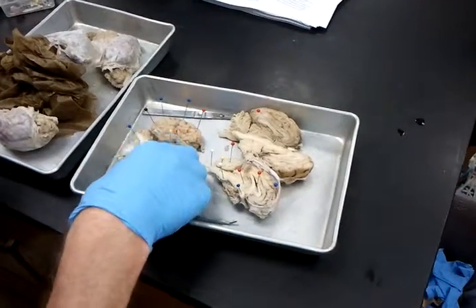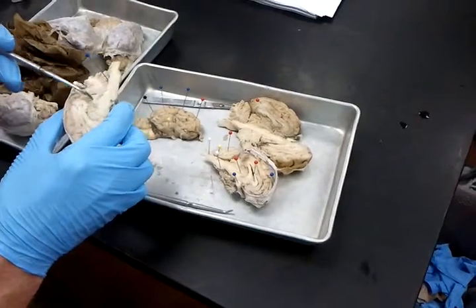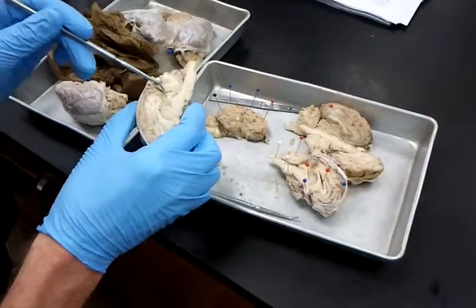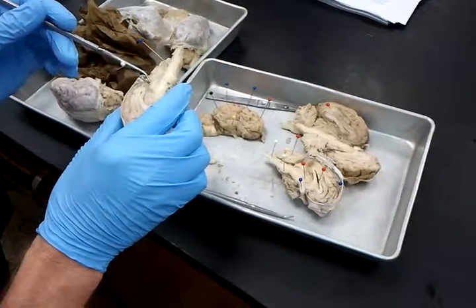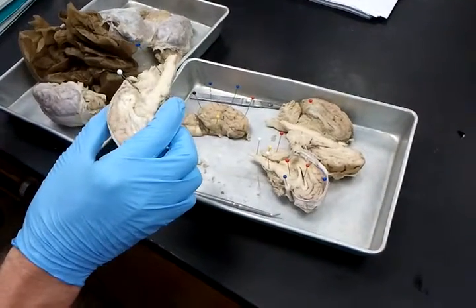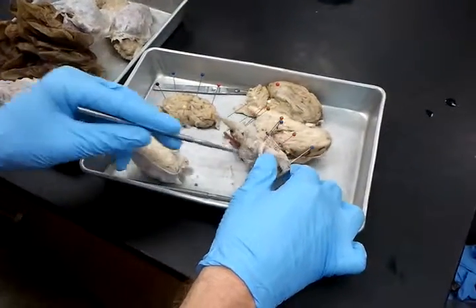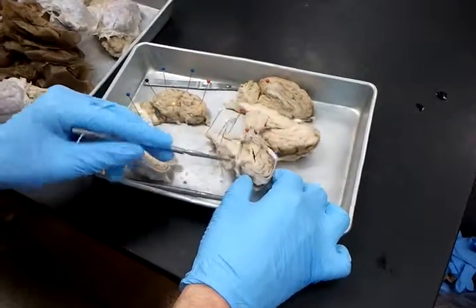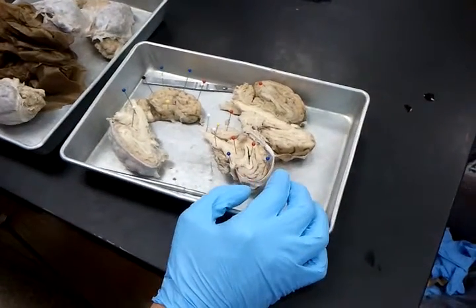The pineal gland, usually these are missing. I'm pretty sure it's this right here. Usually we end up losing these during the dissection, but that is what I want you to identify as the pineal gland. The hypothalamus I'm not going to worry about. Pituitary gland I'm not going to worry about. Optic chiasma, that right there. So you see it, the structure below it. So if I have that pin, I'm asking about the optic chiasma.